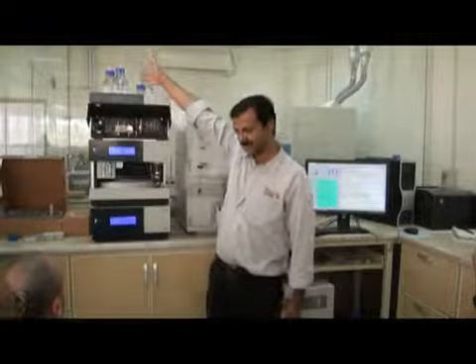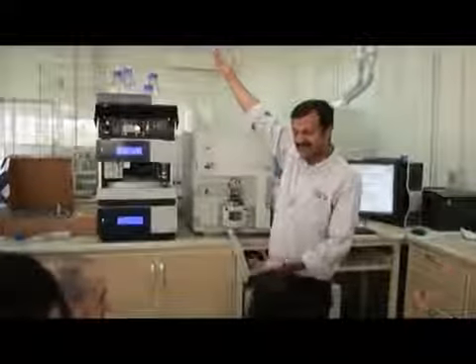Okay. So we put on line A and we open the drain valve already and then press purge. This is giving you a message: purging will deliver high flow rate, ensure that the purge valve is open. I said yes, it's open. Now purge is on and it is working. You hear the sound, tick, tick, tick, line A is purging. Why is purging used? We need to remove any bubbles. If there is any bubble in the line, we have to remove it and fill this line with a fresh mobile phase. This is why we do the purging. Okay. Now line A is purging.